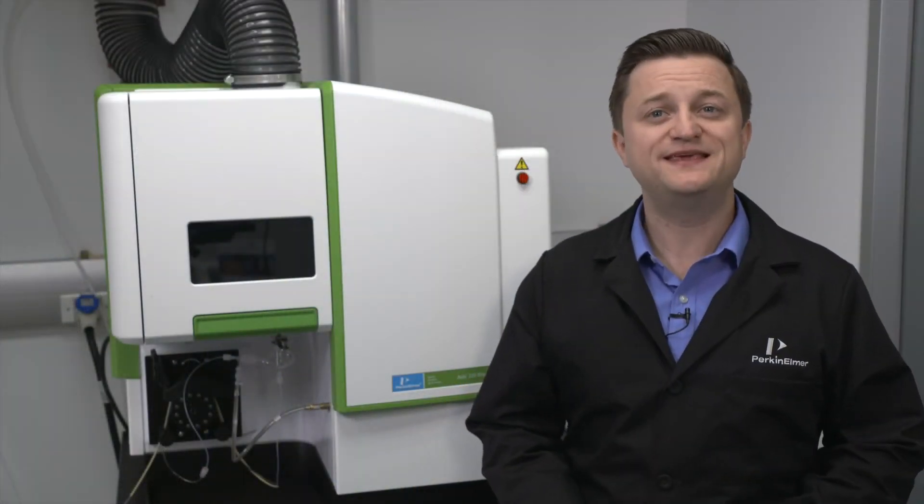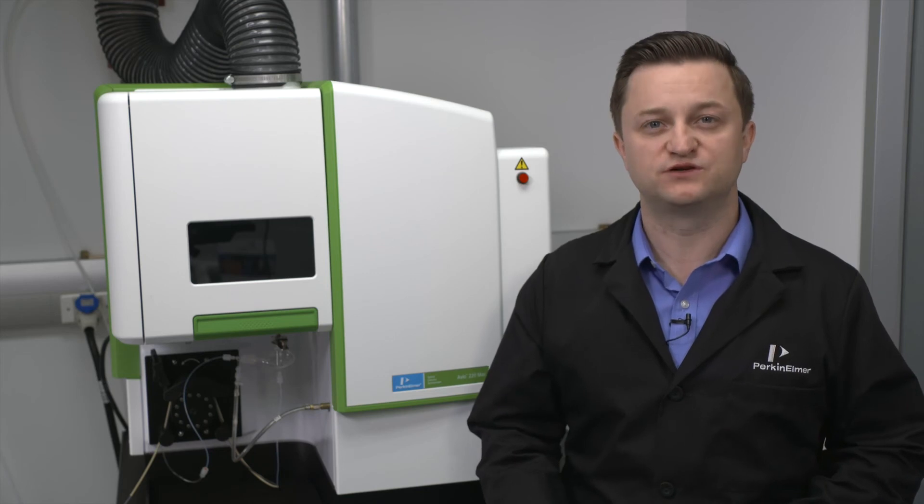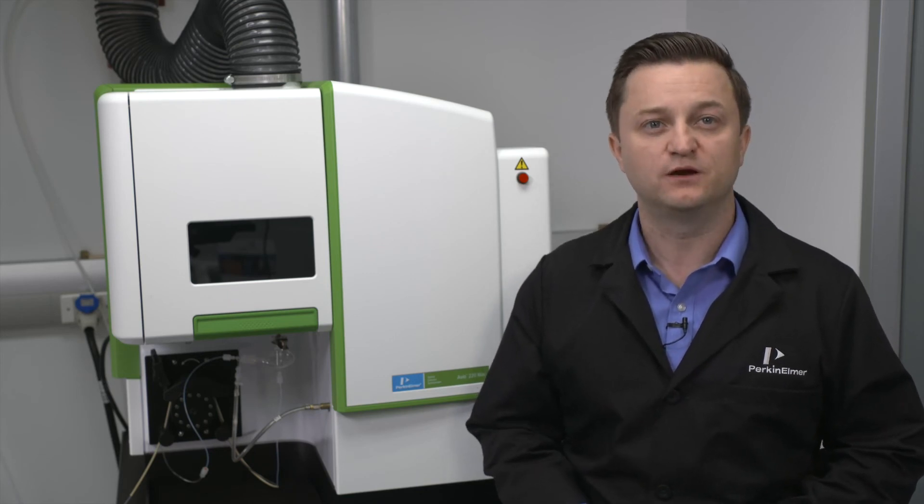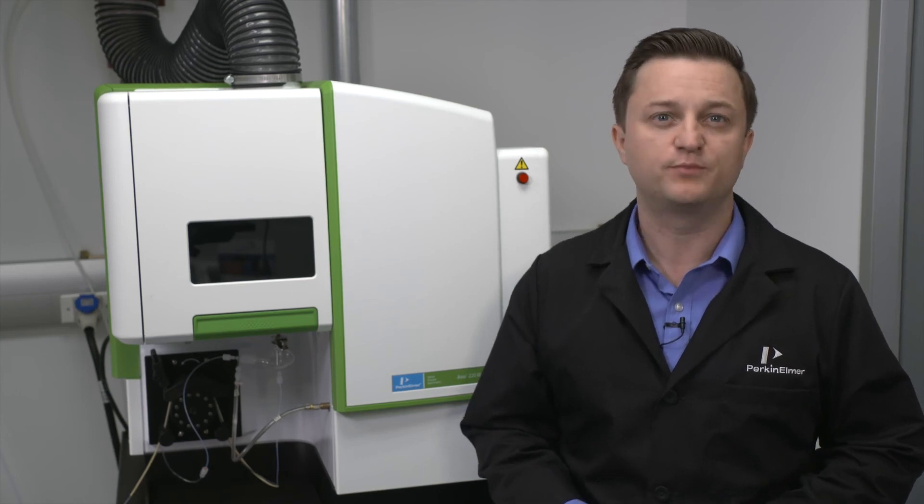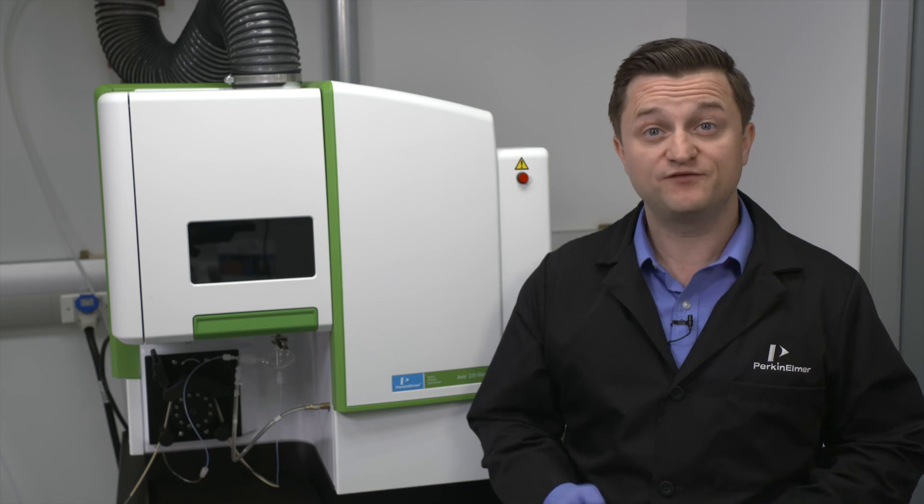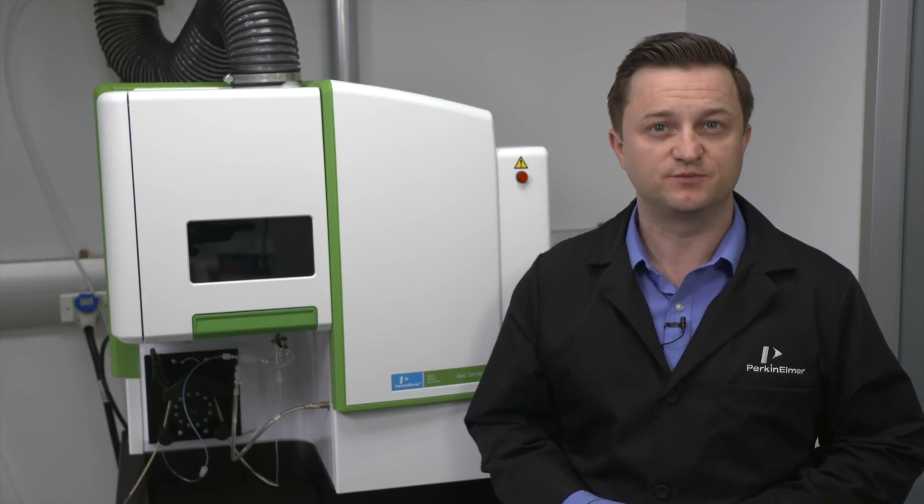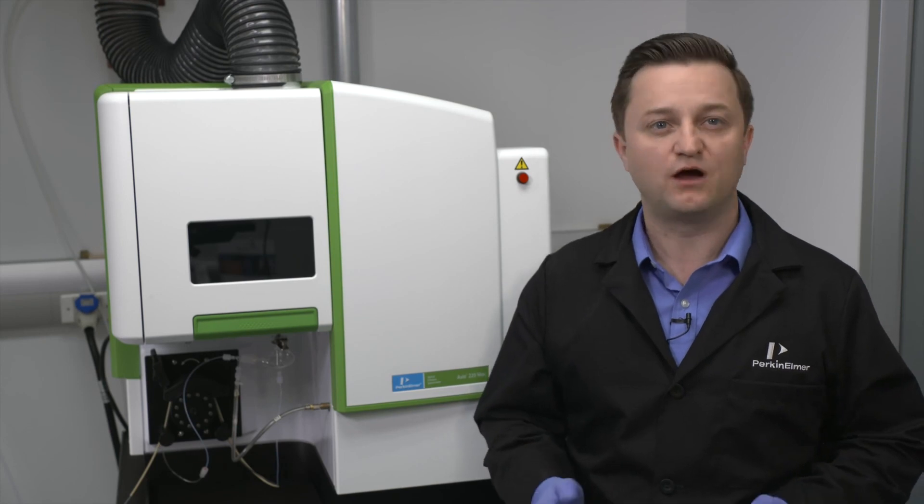Your software manual and these how-to videos are great resources to help get you familiar with your ICP instrument and software. For additional training, I would recommend signing up for a PerkinElmer training course or contact your local PerkinElmer representative for additional options. For more information on how to maintain your Avio ICP instrument, continue watching our Avio ICP how-to video series.